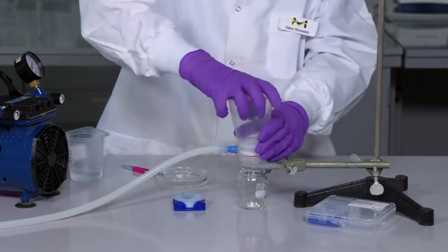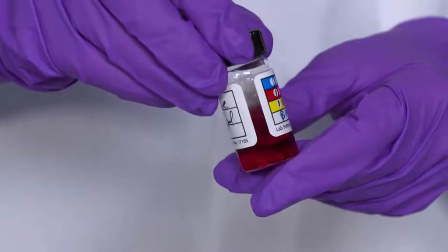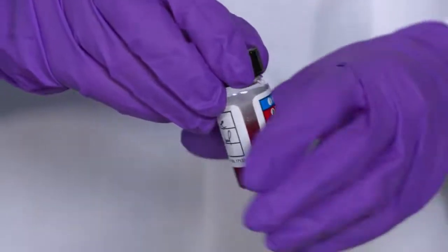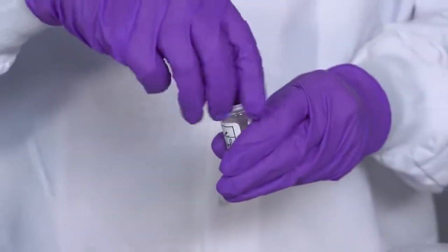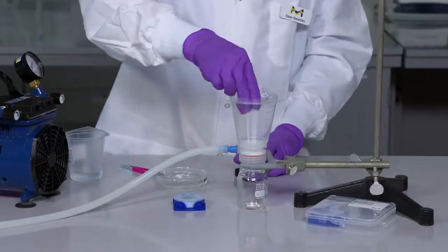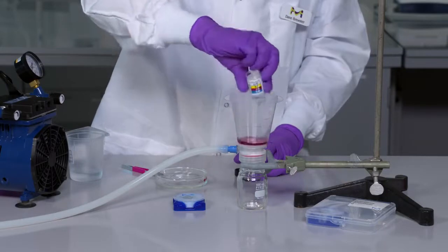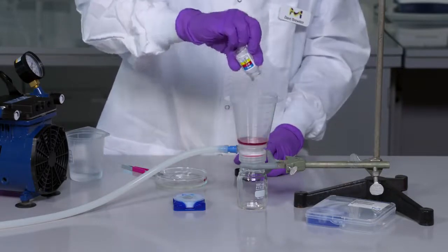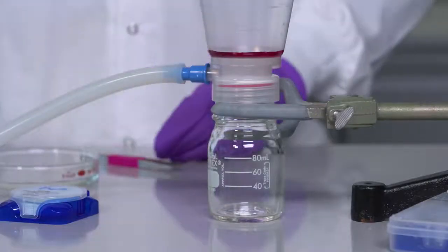Snap the filter cup in place, add the solution of interest, and apply vacuum.